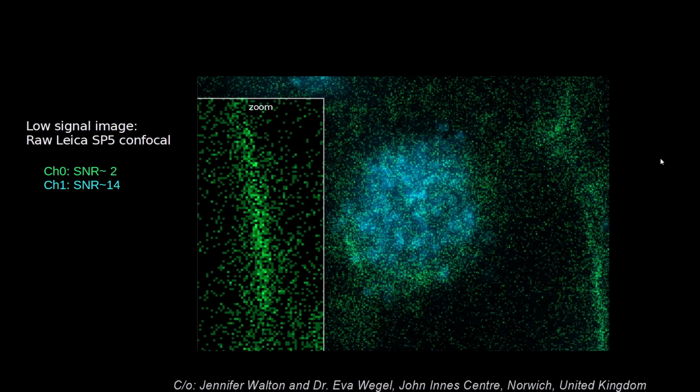Many microscopists are struggling with low signal samples, which are difficult to image. Take for example this confocal dataset from a Leica SP5. It has a signal to noise ratio of 2 in the green channel and 14 in the blue channel, which is quite low.